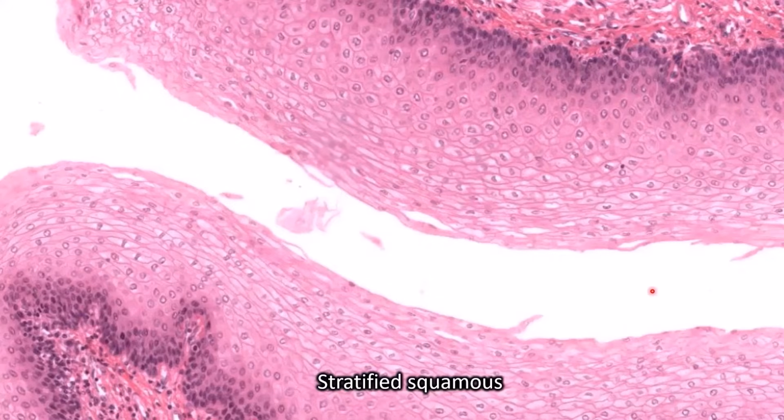This is stratified squamous because you've got multiple layers of pancake-shaped cells. Now I will point out that as you go down in stratified squamous, the cells do start to look cuboidal, but we don't care about that part of the layer, we only care about the part near the top. Also, in stratified squamous, you oftentimes find a darker border towards the bottom of the epithelial layer, which is helpful when you're looking at something from far away. Even from far away, if you see that dark purple border, you should suspect that it's stratified squamous.